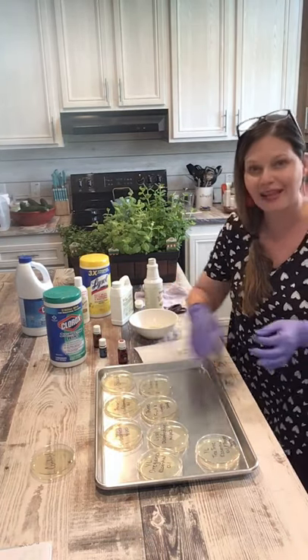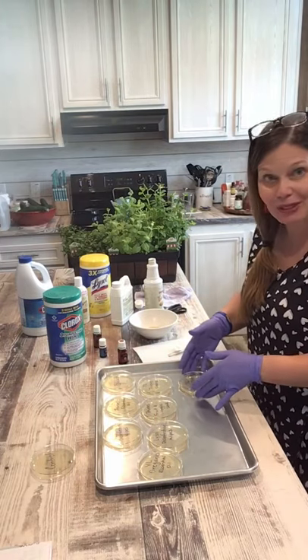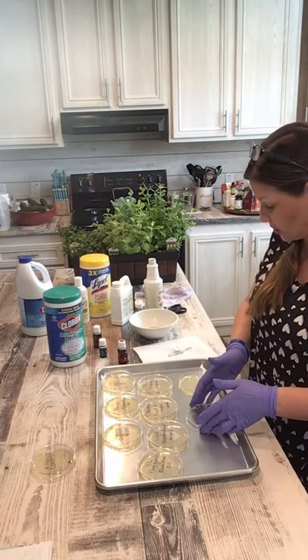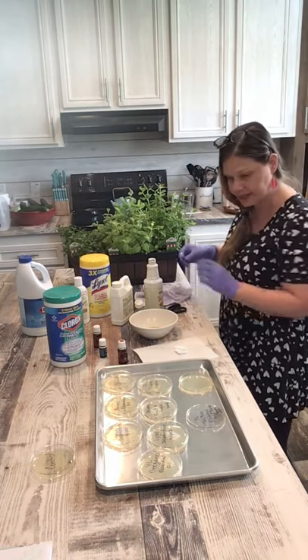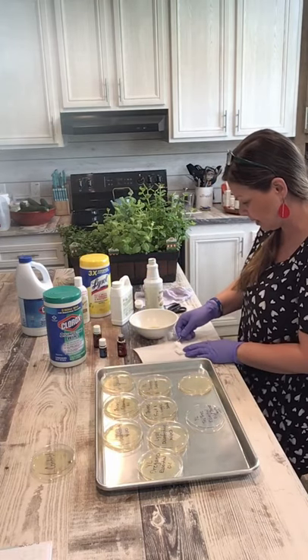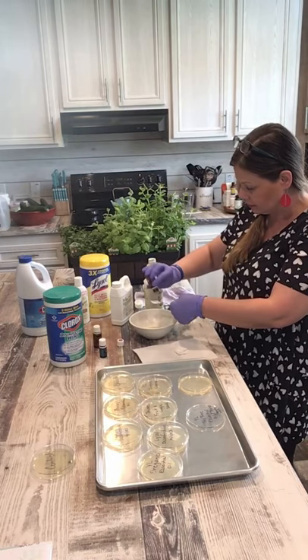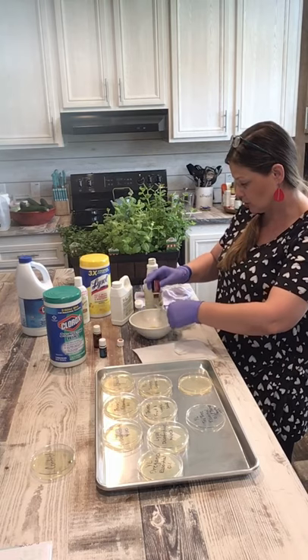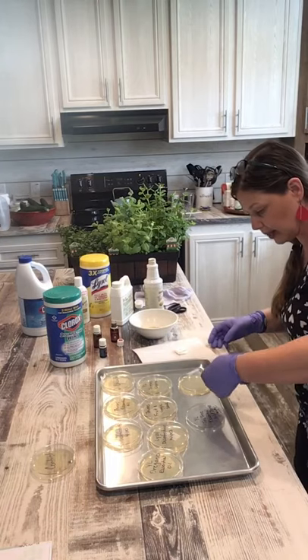Last but not least — my special one — Young Living tea tree essential oil and Thieves mouthwash. I'm going to put the tea tree essential oil on the left, exactly how I have it marked on the top of the petri dish, and then I'm going to put the mouthwash on the bottom. Do your research on tea tree too — lots of yummy goodness with tea tree.